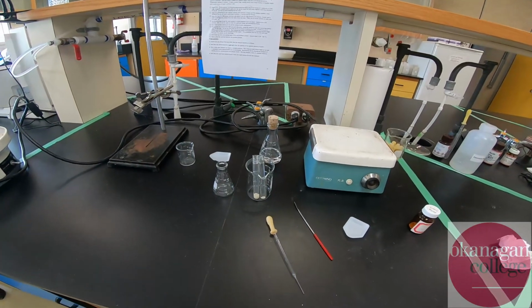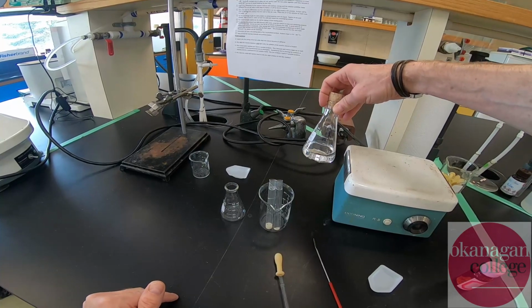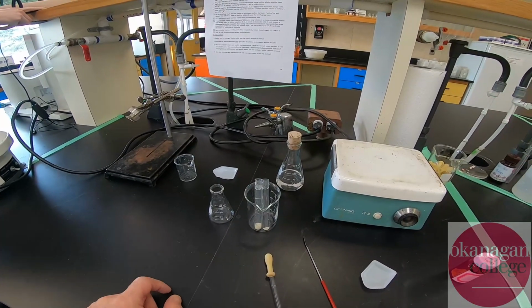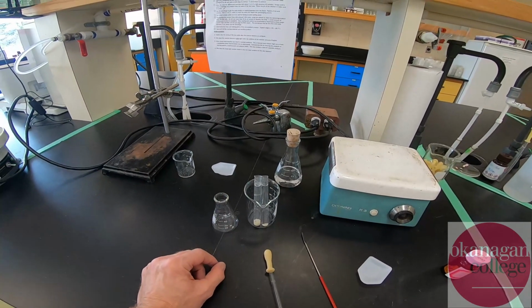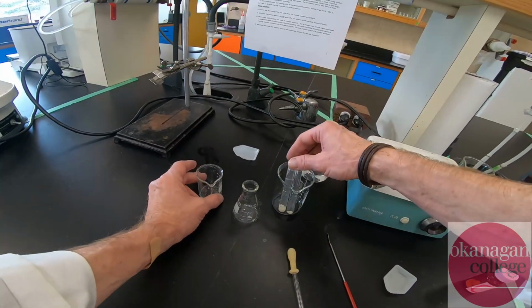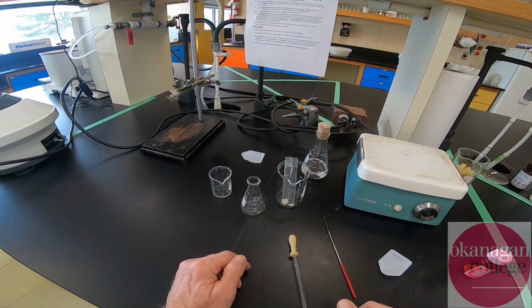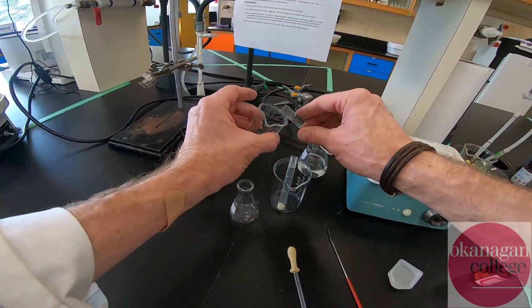Okay, so I've assembled some material. I've made up approximately 50 mils of solution of ethanol water mixture. That's going to be my recrystallization solvent. I have my 2 centrifuge tubes, and I'm going to be transferring the solid into a recrystallization Erlenmeyer flask. Careful eyes might see that we have a small amount of glass left over here from a small accident. We can deal with that a little bit later once we've done the recrystallization and filtered out our material. Okay, so to start with, I'm just going to discard the water into a waste beaker.